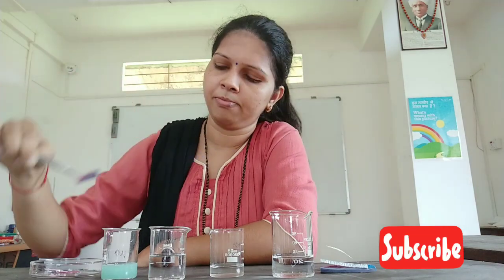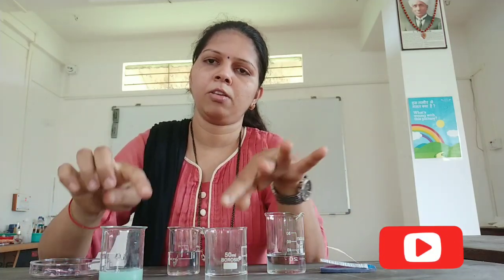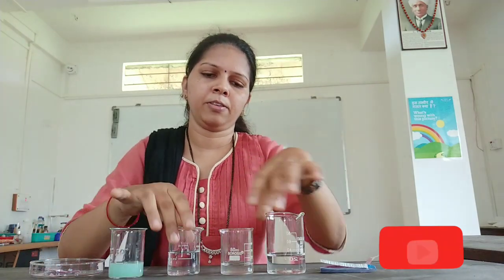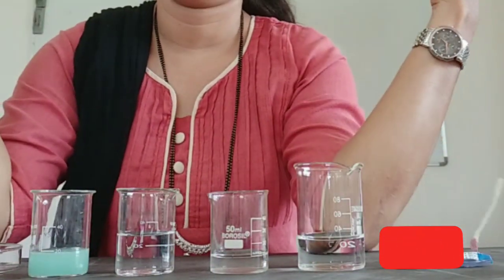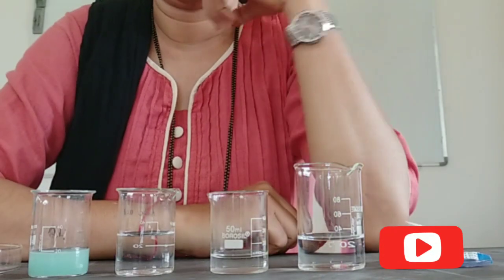So what do we conclude from this? The substance present in beaker B and beaker D must be basic because there was a color change — the red litmus paper has turned blue. So with the help of this activity, by using a litmus paper indicator, we can find the nature of a substance, whether it is acidic or basic.